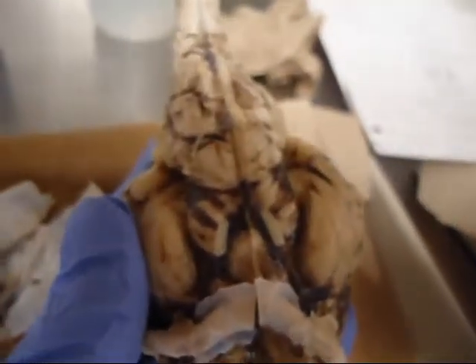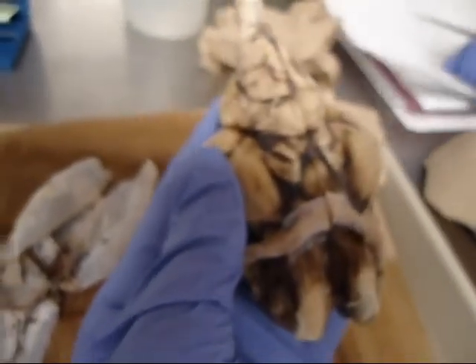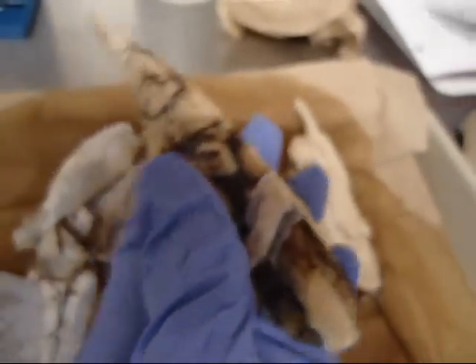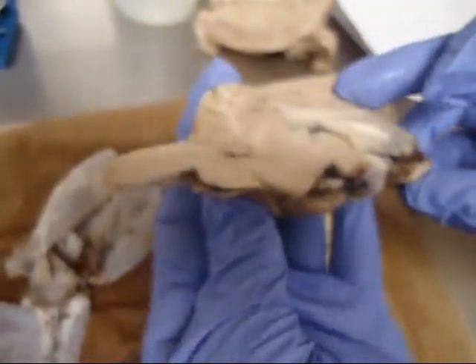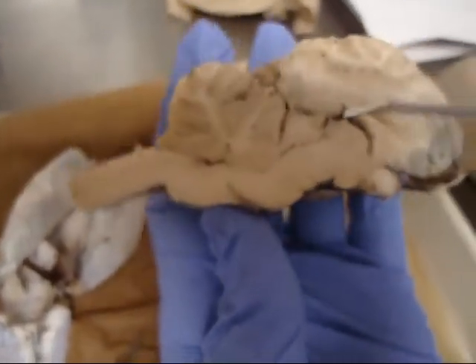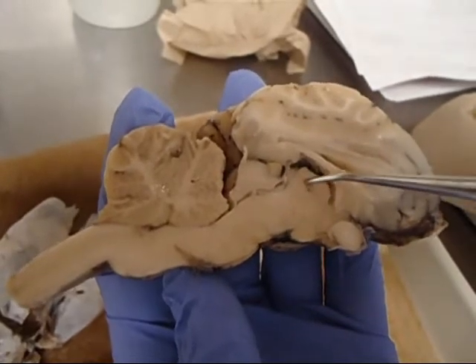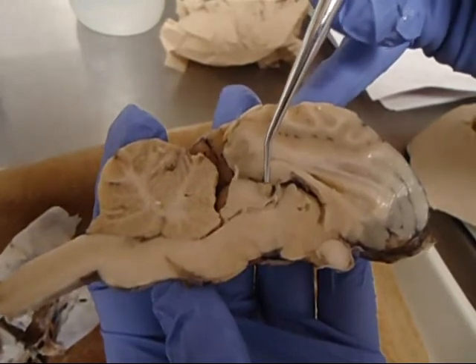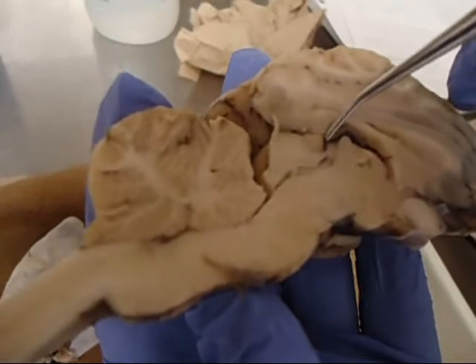And did we mention the pineal gland? No, we didn't. Okay, an easy way, he said, to find the pineal gland: it's the small lump or bump, and it's pine cone shaped, and he said just think of it as TIP. If you can locate these three things, you locate the tectum, which is here, the intermediate mass, which is here, the pineal gland is going to be in between the two, and it's just a pine cone shape. I'm trying to locate it here.